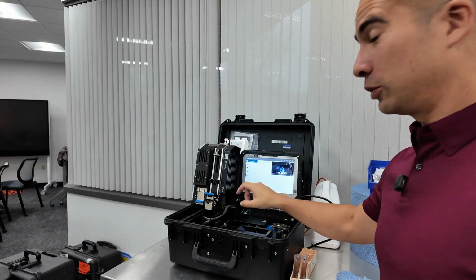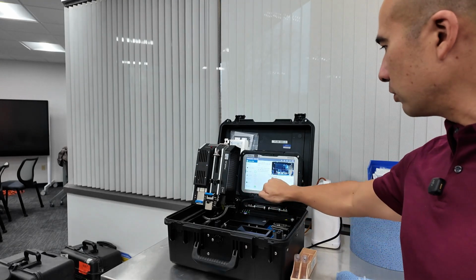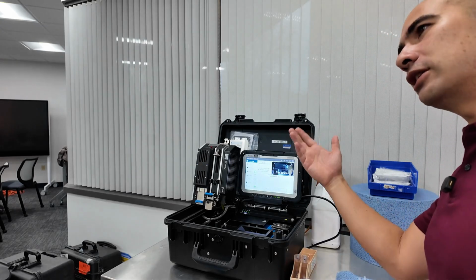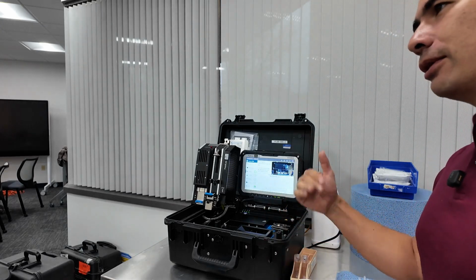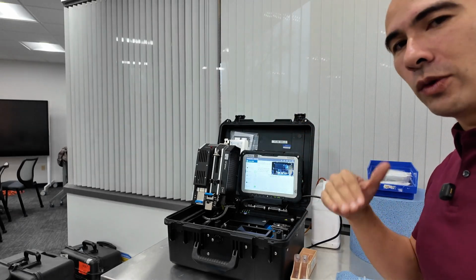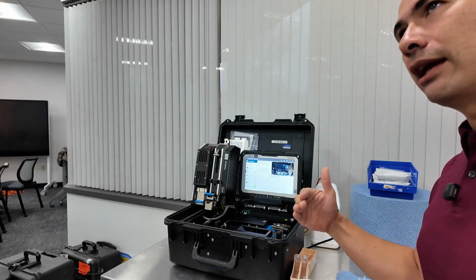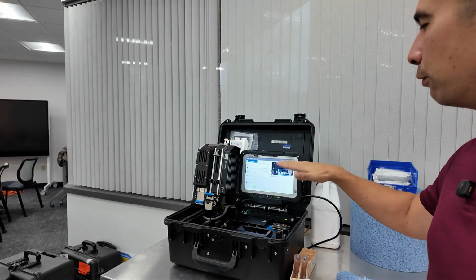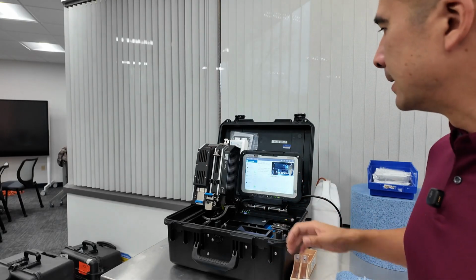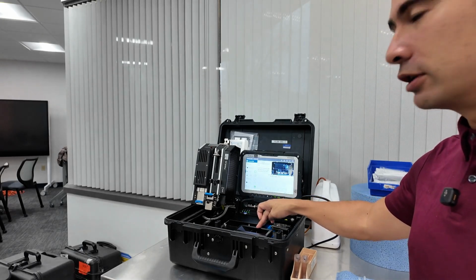Okay, so we're going to skip around a little bit here. We can go back to the viscosity, test completed, and it'll give you the viscosity at 40 degrees C, so 87.8. Obviously, if we're testing engine oils, most of the time we're trying to measure at 100 C. In an industrial setting, 40 C is what we're doing for most of the ISO viscosity grades. You could calculate out a viscosity at 100 C if you know the 40 C as well as the viscosity index, assuming that there's been no shearing down of the oil. So that's us testing the viscosity, all done in this very, very small cell.